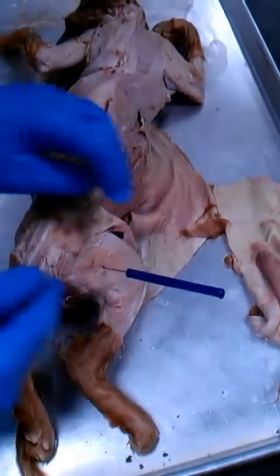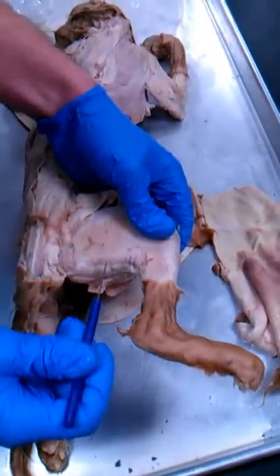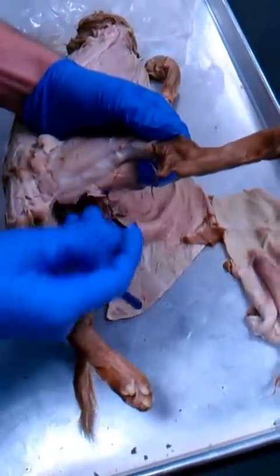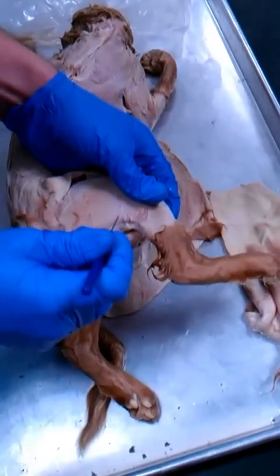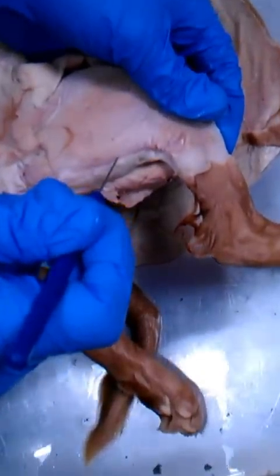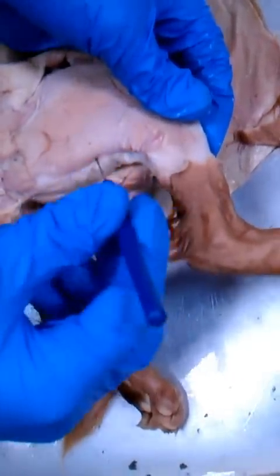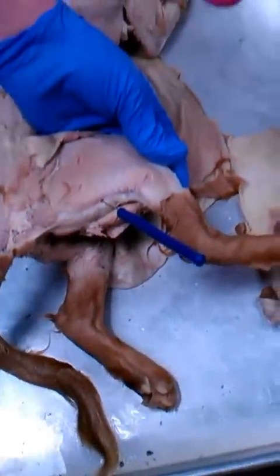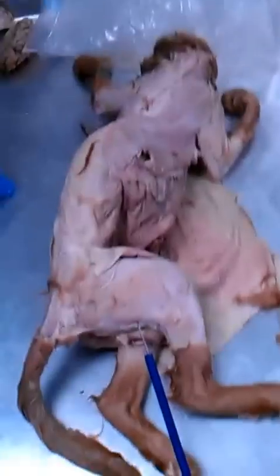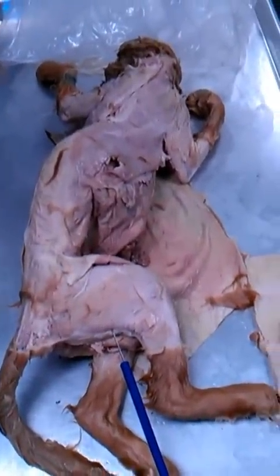Now, the semitendinosus is sometimes hard to see, and on this cat it's very hard to see, but there's a tiny little line right here, and everything below that line, right on the very edge, as long as it's still on the outside of the leg, which is going to be the lateral side, that's the semitendinosus. Show everyone. That's the semitendinosus. Everybody good there? Yes.